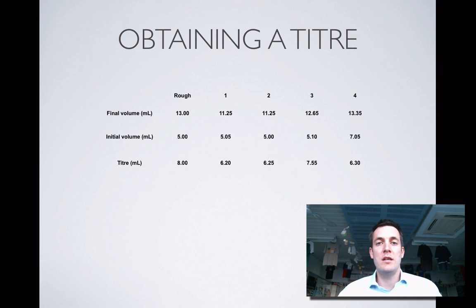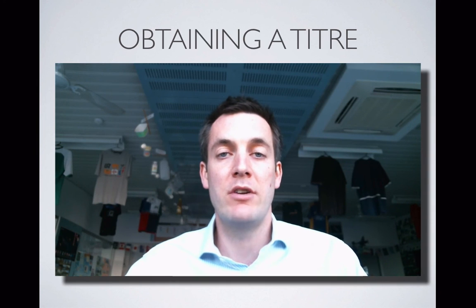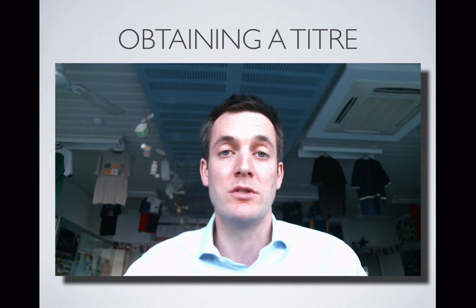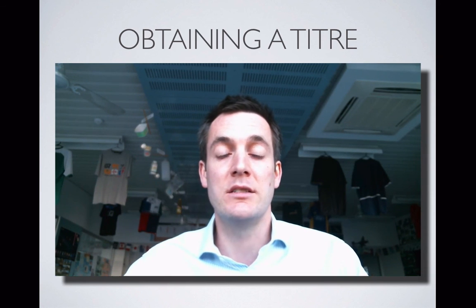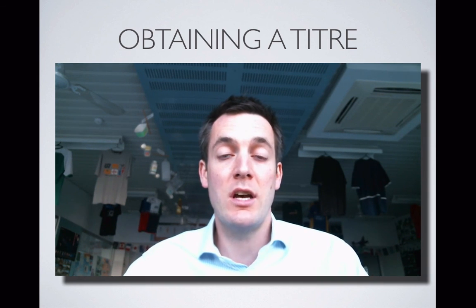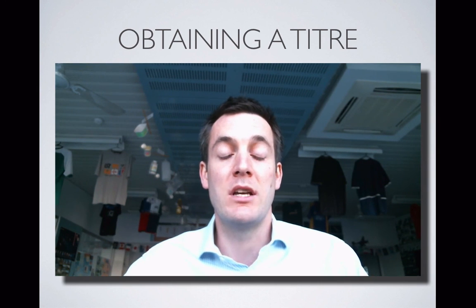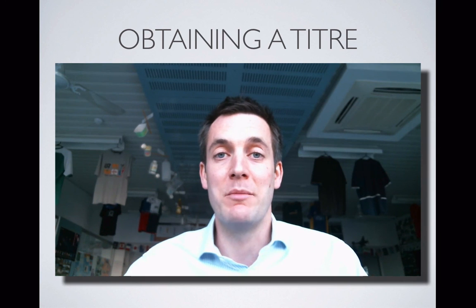Okay, well that's it for all the practical films. You know how to carry out a titration. As I've said before, these practical skills do come in handy in the redox topic as well, except you'll be using different reactions and different indicators, but the principles remain the same. You may have some questions about these practicals, in which case please do feel free to come and ask. If you've spotted any mistakes on the films, it'd be great if you could let me know or if you could comment on the YouTube just so that other people aren't misled by them. Anyway, good luck with your practicals.